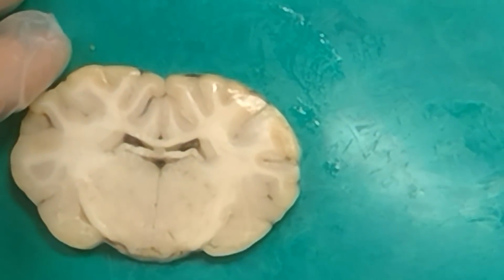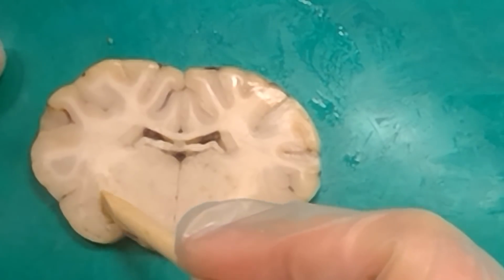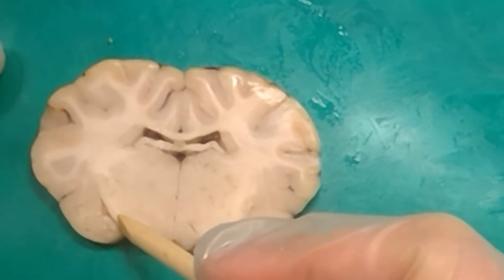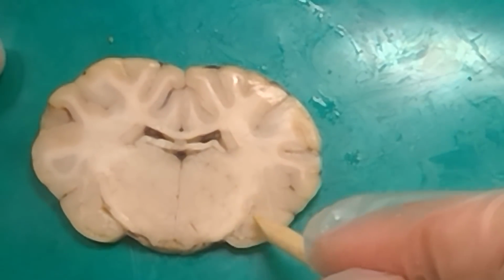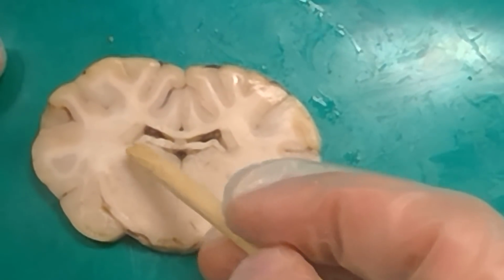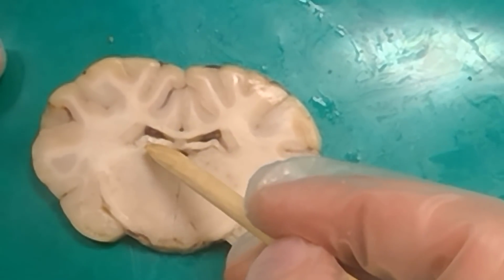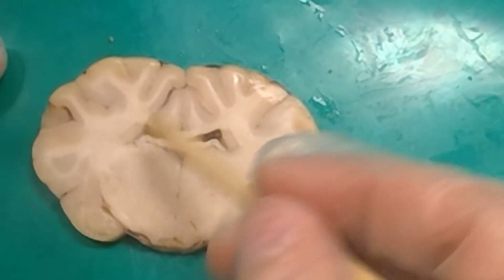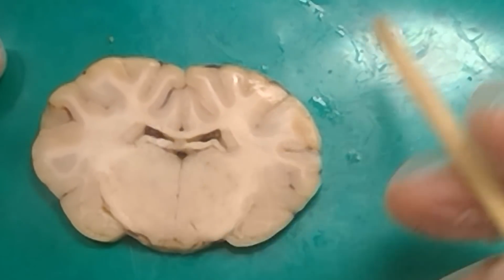Maybe we can see more on one of these. Here's another. So this is another one where you can see hippocampus right here because we've got these curls that are happening in here, where you have a similar shape, but there are some white lines going through parts of this, and that's how you know you're at hippocampus here. But you can still see the fornix up here, so it's before it's become full hippocampus at the top. You can see the caudate nucleus up here at that lateral wall of the lateral ventricle still.